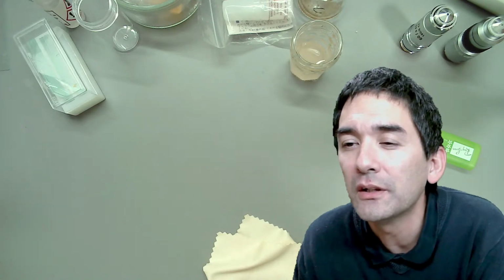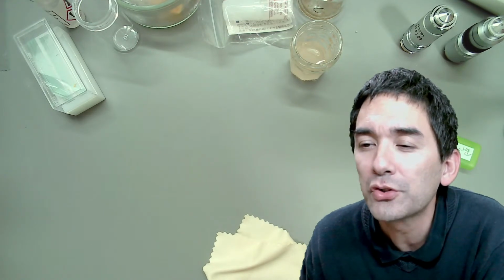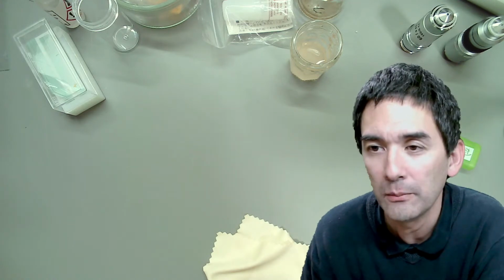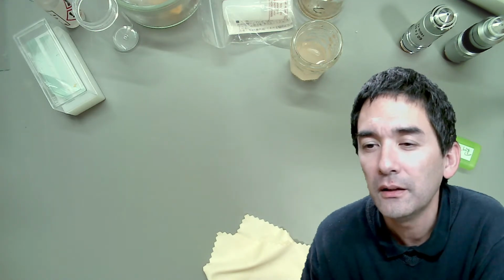Start with things in the house, like dust, yeast, sugar. Yes, there are plenty of things that you can find at home. Oil immersion microscopy has many pitfalls: breaking the slide, scratching the objective, many steps involved. Yes, and for this reason, I do not recommend oil immersion microscopy for beginners. Okay, thank you for the advice.